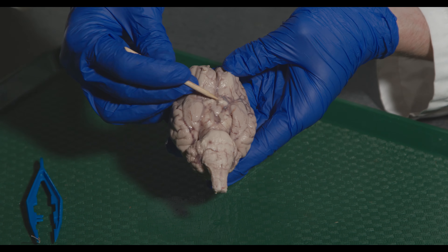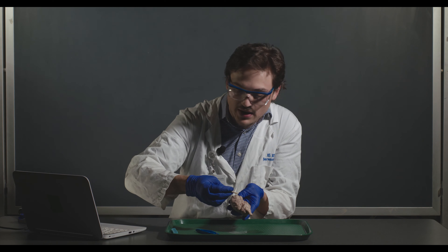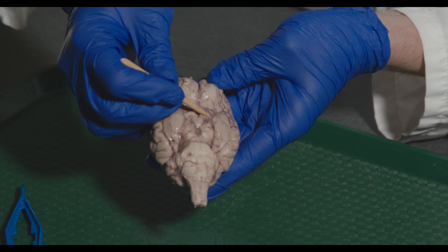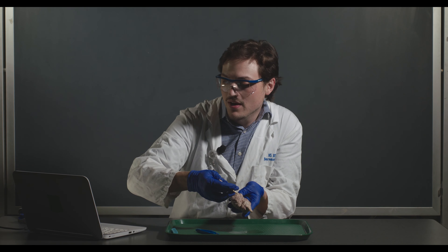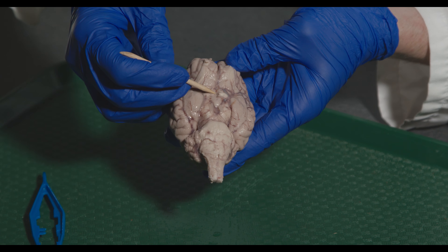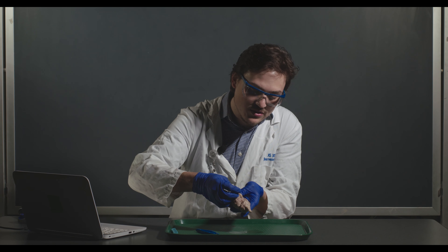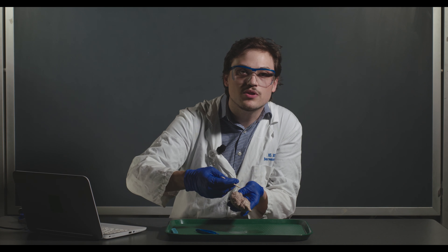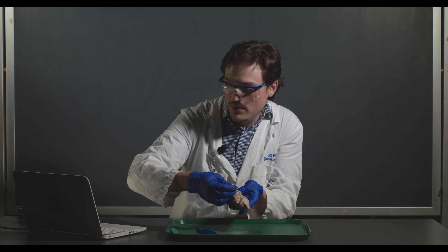Then we have the optic nerve, which comes together to form the chiasm — though on these sheep brains it's damaged where the dura was removed. The optic tract, which you can still see here, sends visual information to the lateral geniculate nucleus, one of the nuclei of the thalamus that we'll learn about in our thalamus lab. The infundibular stalk is the tissue that connects the pituitary gland with the hypothalamus — you can see a little hole between the mammillary bodies and the optic chiasm where it would be.